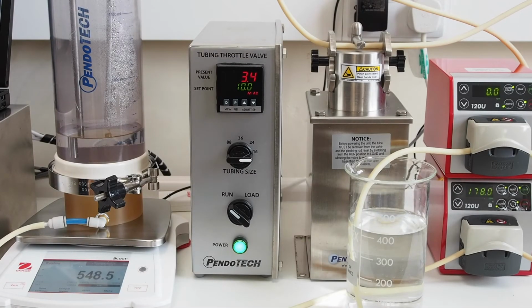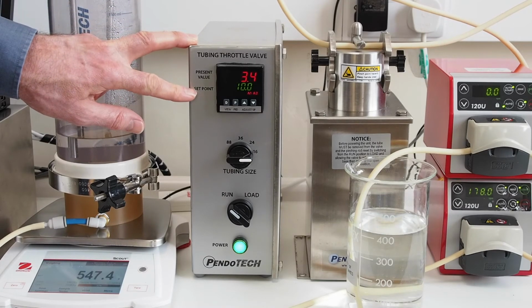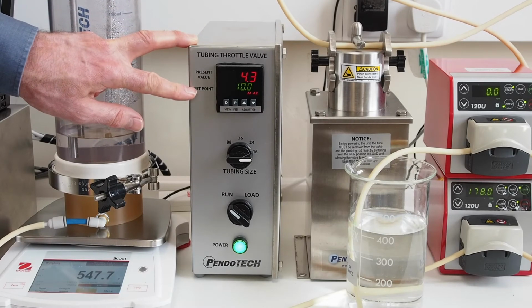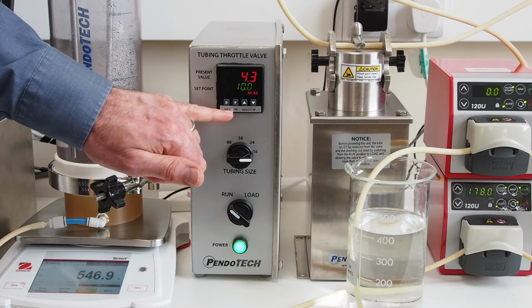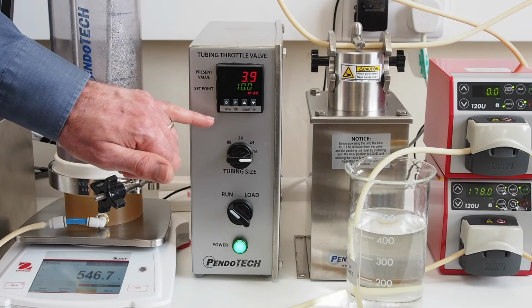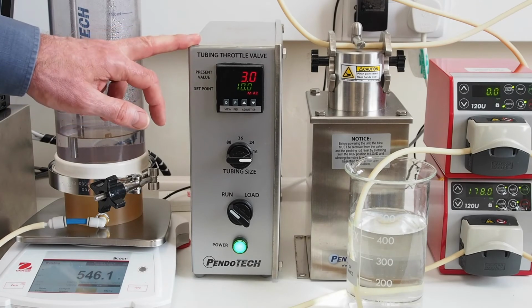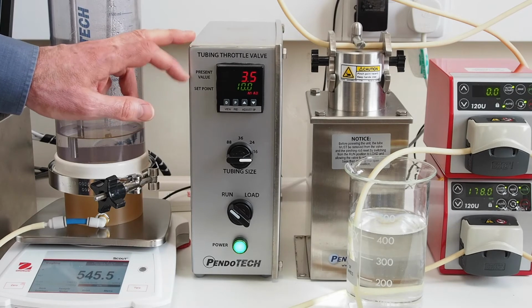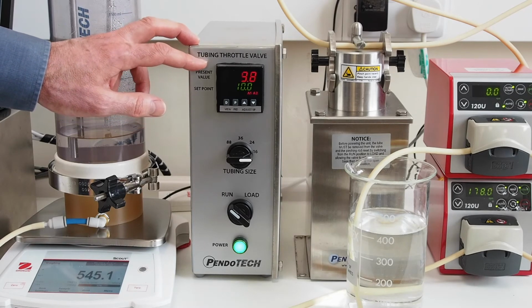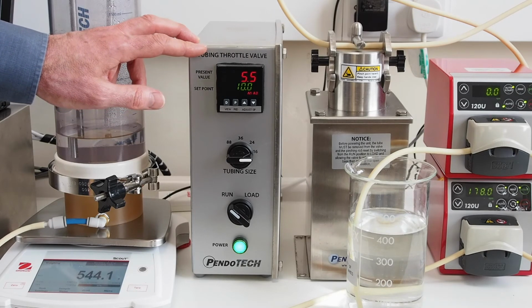In our setup, we've got the throttle control valve. We've put our set point to 10 psi, and at present you can see the pressure increasing. We've got PID control on this, which is on the factory settings. If you're experienced enough, you can go in and make changes to those settings. But we've got a flow rate which should slowly build up the pressure and control at around 10 psi.